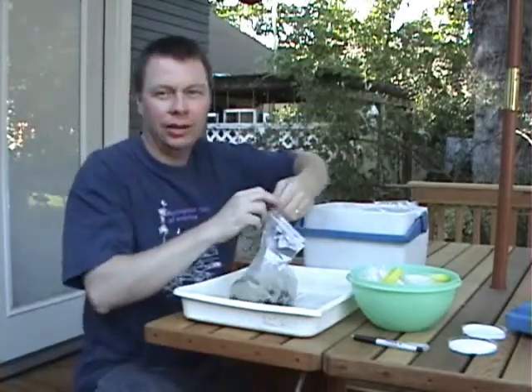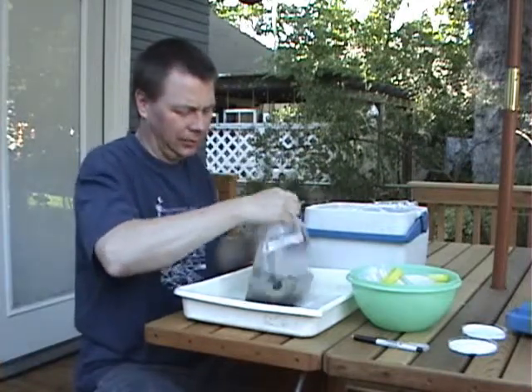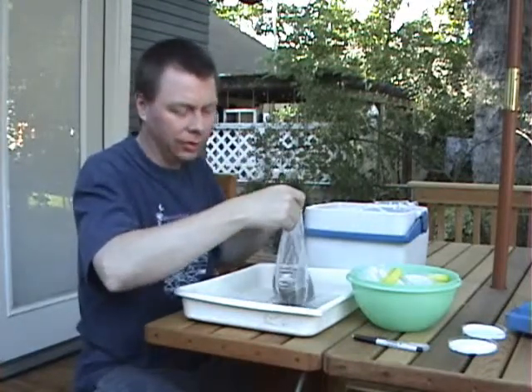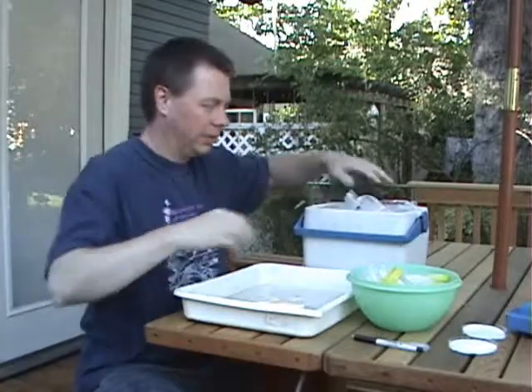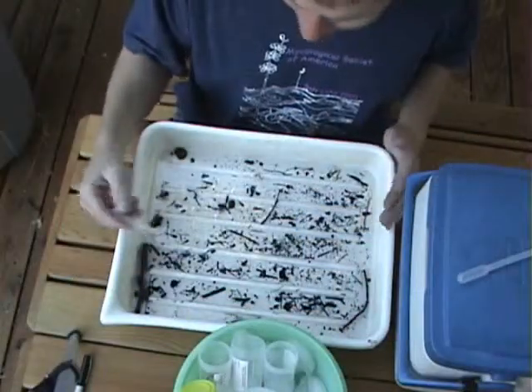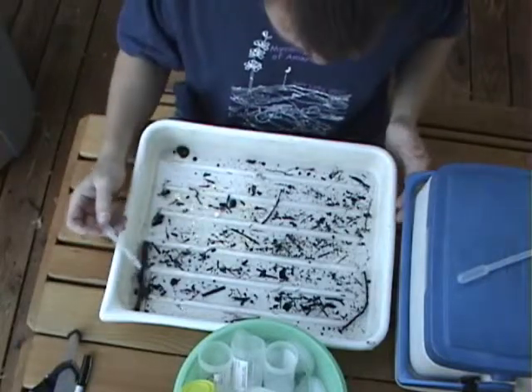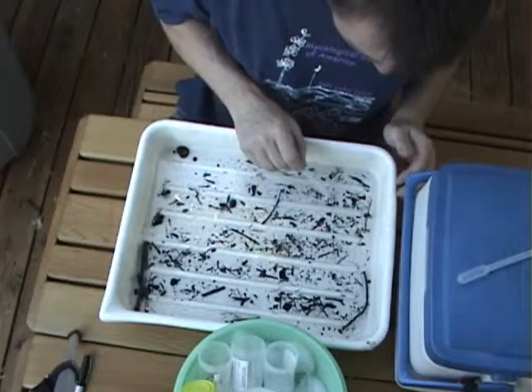Typically I just empty the material in small amounts into the pan, and then we can just pick some of these hosts out of the pan in smaller subsections of the sample. We're going to keep everything on ice so they can stay a little bit healthier. This is your first opportunity, other than in the field, to see what we have here. We know we're going to have some larval aquatic insects for sure, and sometimes you'll have adult isopods as well. What we have here is just a visual check with nice fresh specimens.